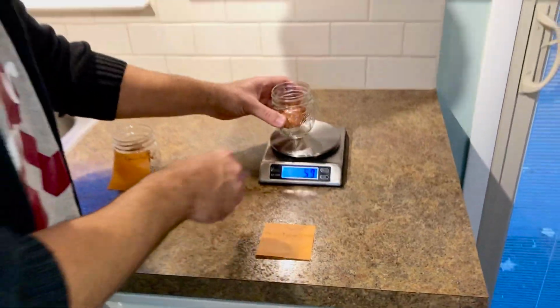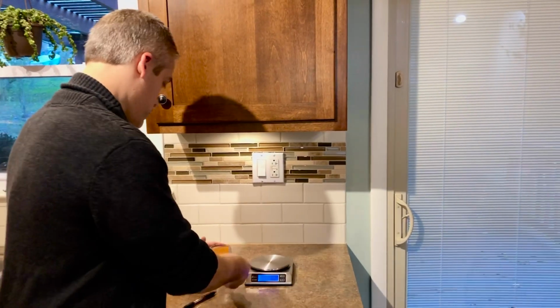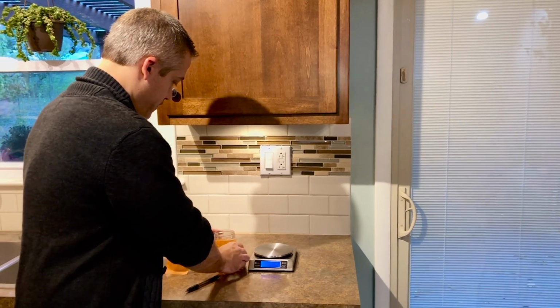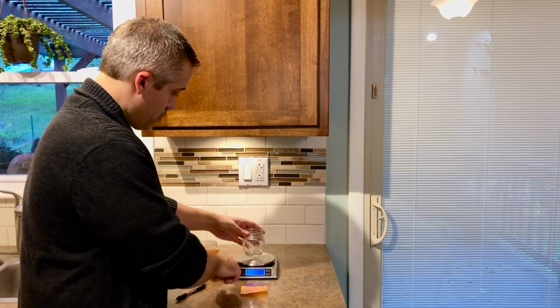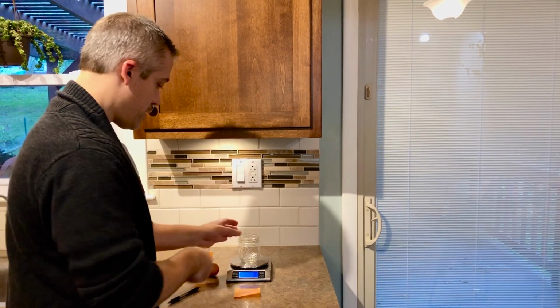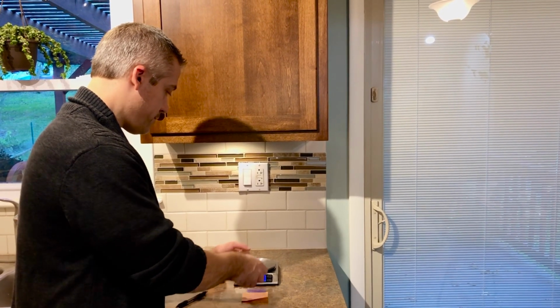Now I'm going to do the exact same thing for egg 2, Eggman-Freud. All right, so same thing. Need to make sure that that's set to 0. It is. Then I can put egg 2, Eggman-Freud in there.